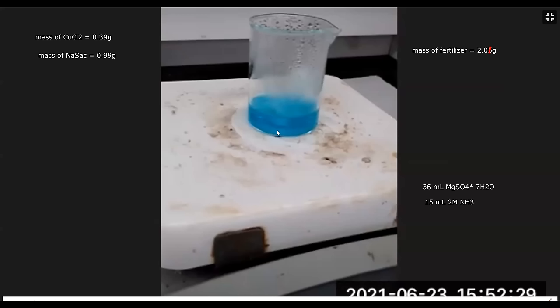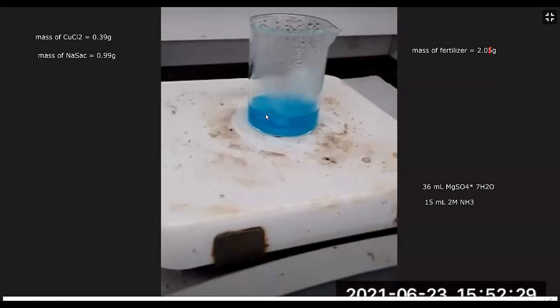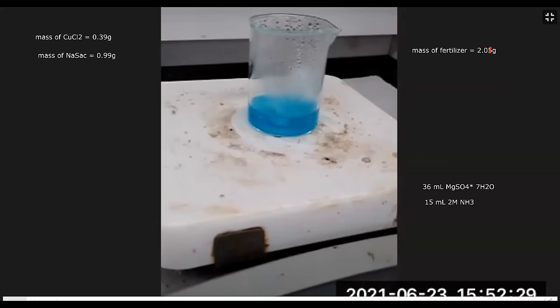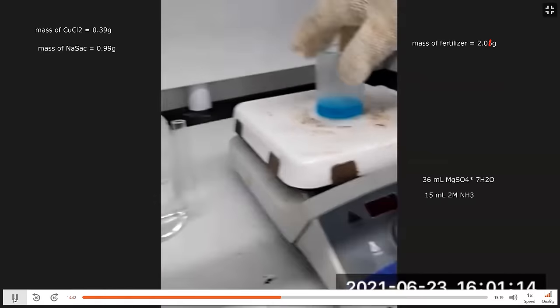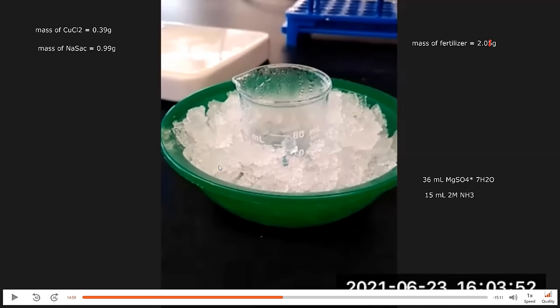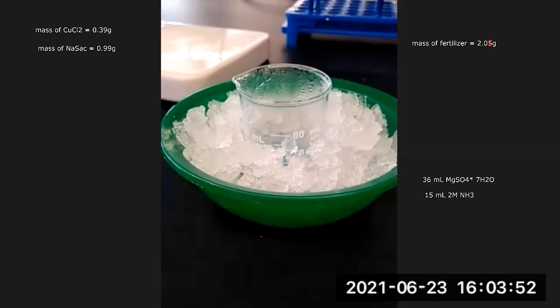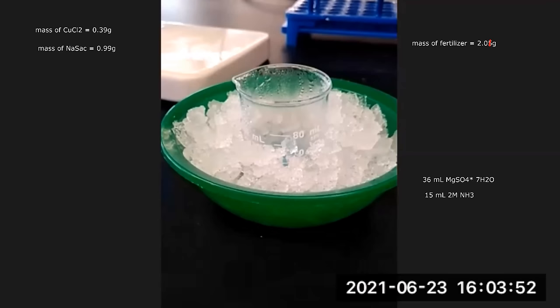While the fertilizer is cooling down, go back to the hot plate with the copper saccharinate solution. By now it's probably time to take it off the heat — you'll see some blue crusting along the edges. Place the copper saccharinate solution in an ice bath as well, so the product precipitates out. Leave it for about 20 minutes — the longer the better if you have time, to get everything to precipitate out.